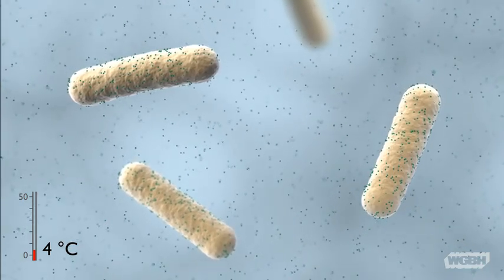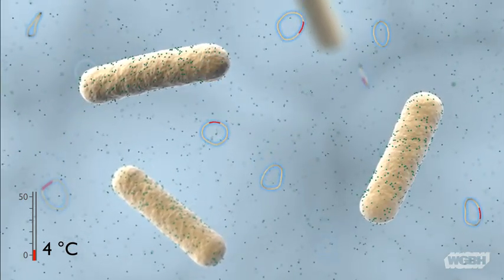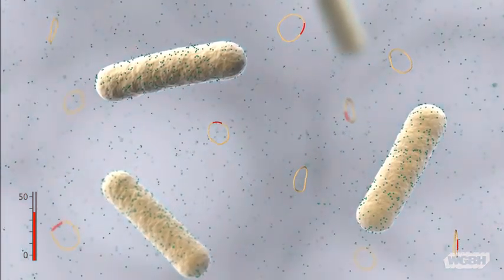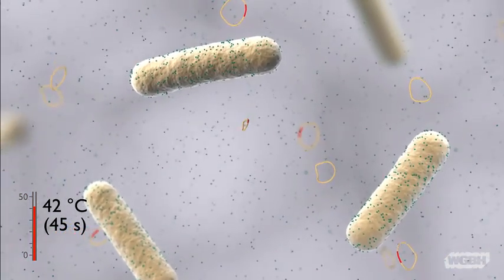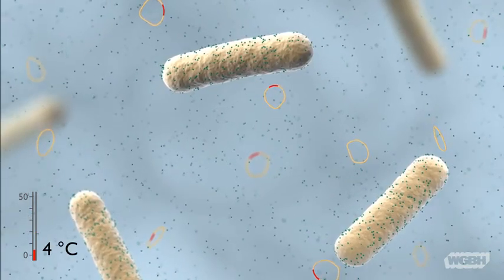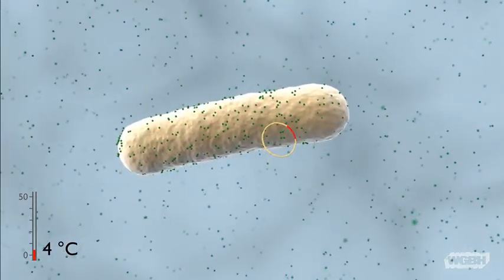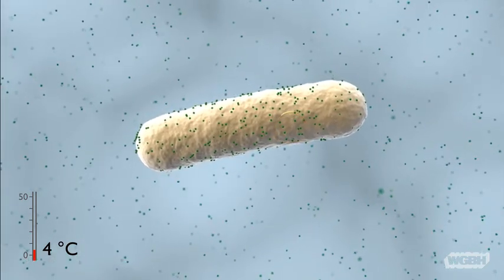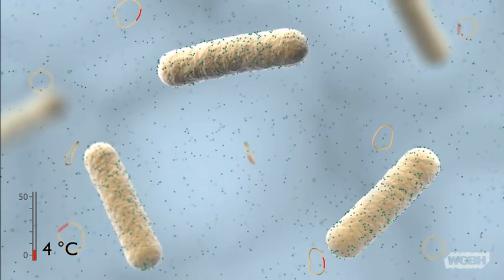Plasmids containing the gene of interest, RFP, are then mixed with the treated cells at 4 degrees Celsius. The temperature is quickly increased to 42 degrees Celsius, and then reduced back to 4 degrees Celsius. This heat shock results in the formation of adhesion zones, creating a leaky plasma membrane, which may enable the cell to take up a plasmid from the solution.